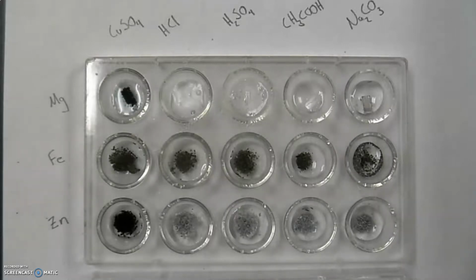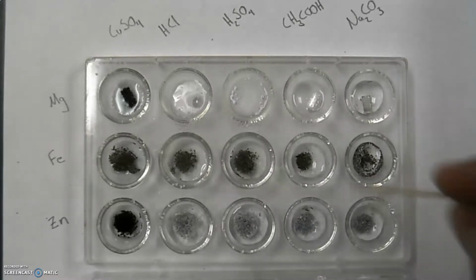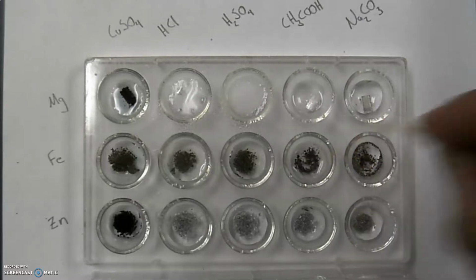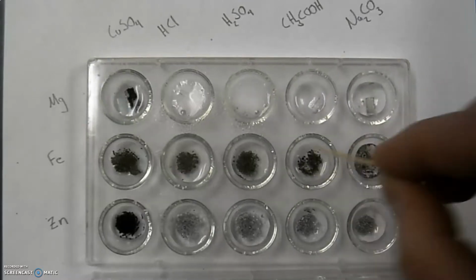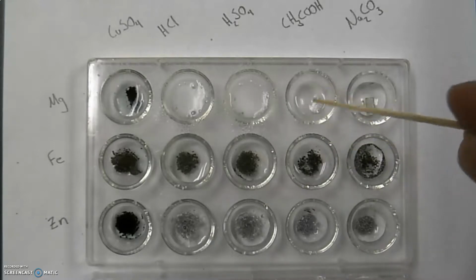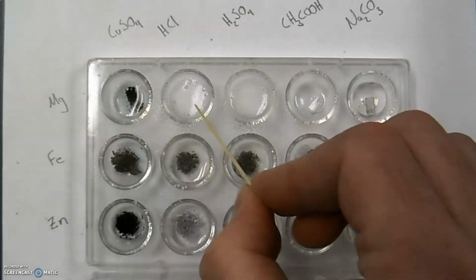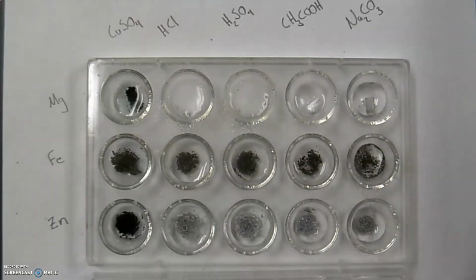So you watching this, and we're getting all the effect that we need out of these to see what's doing what. And I can help along as far as how these are behaving too. Clearly, that's a reaction, that's a reaction. And what is the evidence that we're seeing with these reactions?